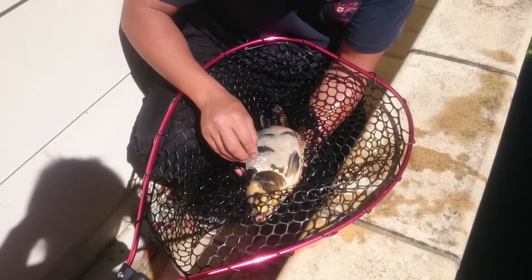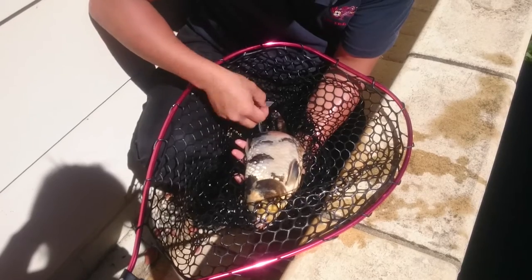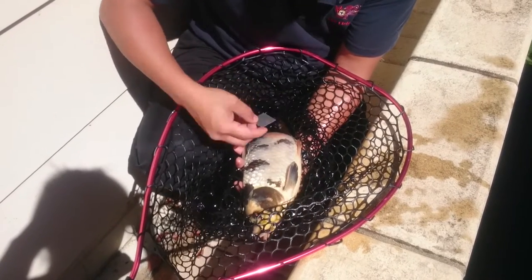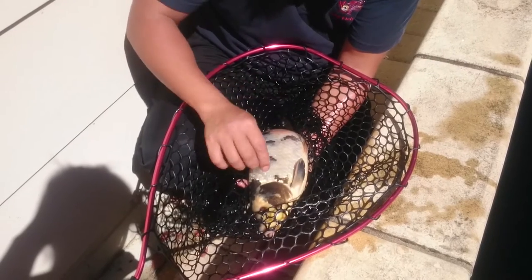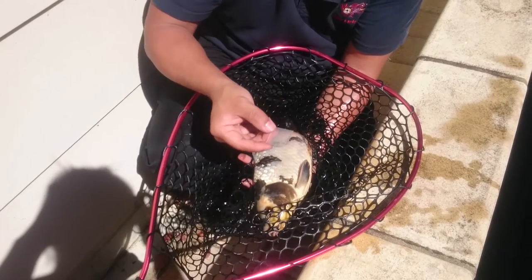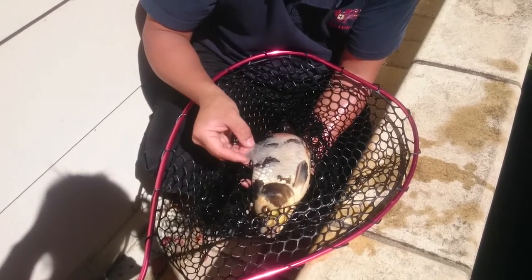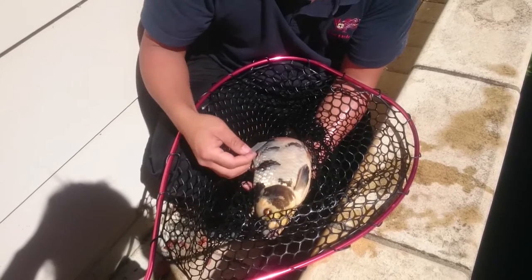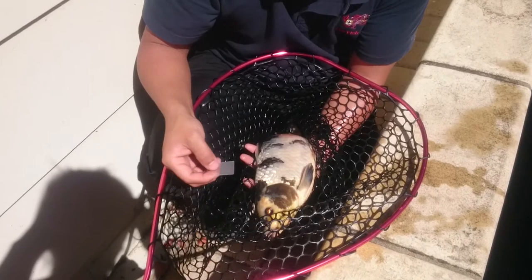If you take your skin mucus scraper, go along the body, along the way the scales are growing, just very lightly, because the mucus parasites basically live in the mucus. If you feel a layer, you don't want to be giving them third degree burns when taking scales out.